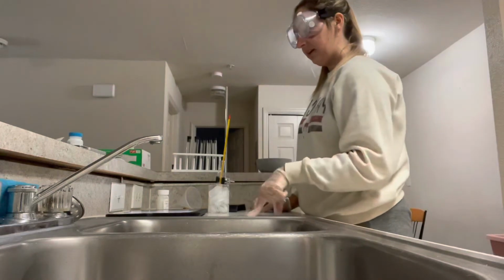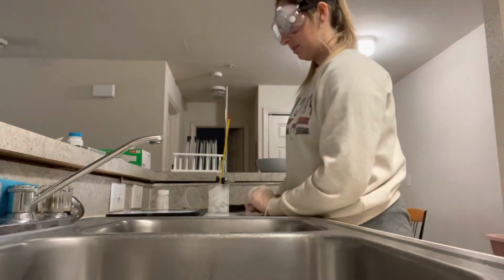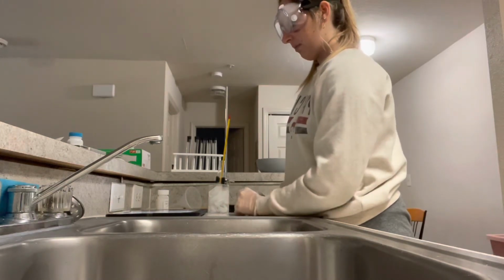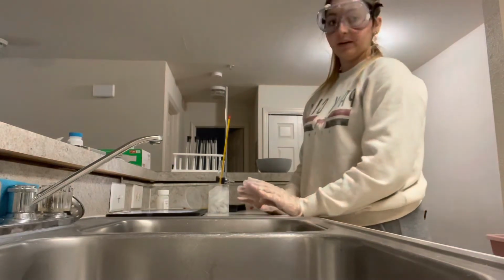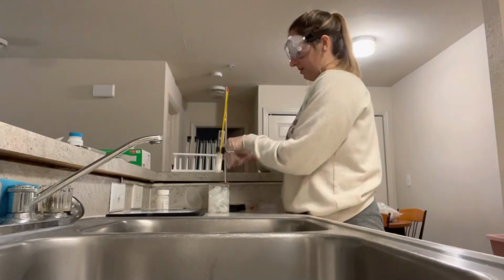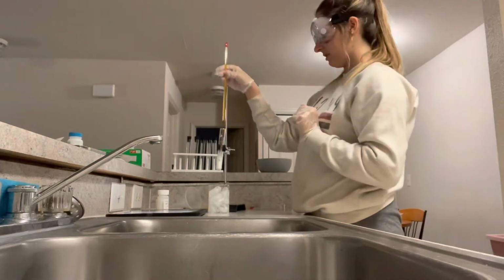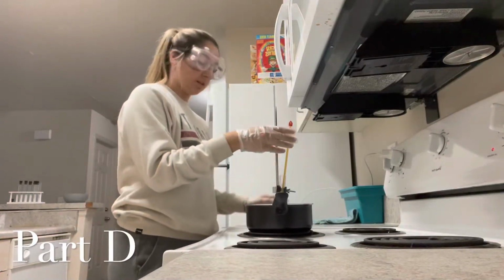So in part D, we'll repeat part B steps 1 through 6, which we've just done, and we will remelt the solution for proper disposal as described in the cleanup. So now we will start disposing of this, and we must start by melting it down, because there's a very specific cleanup process for this.